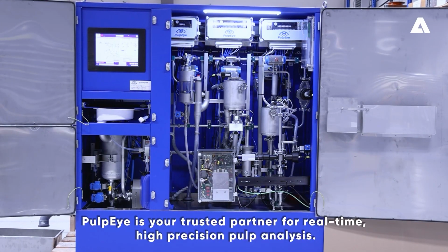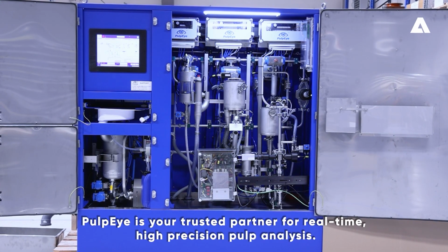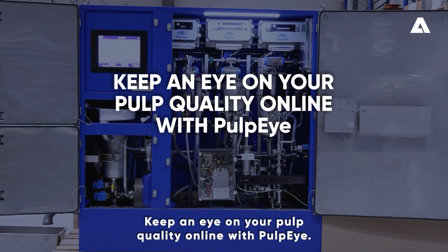PulpEye is your trusted partner for real-time, high-precision pulp analysis. Keep an eye on your pulp quality online with PulpEye.